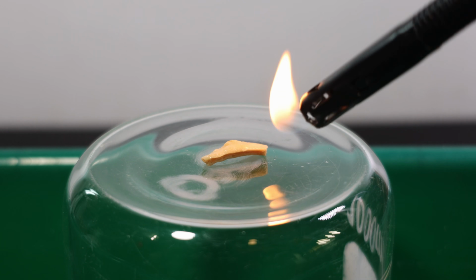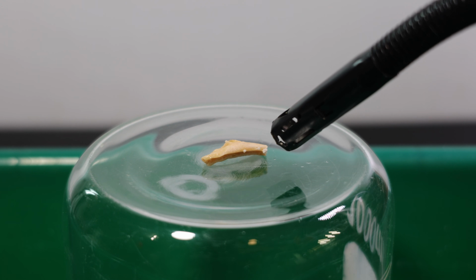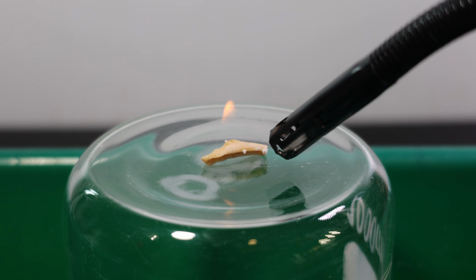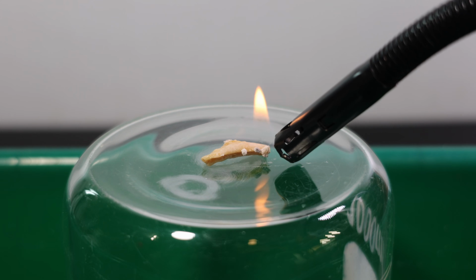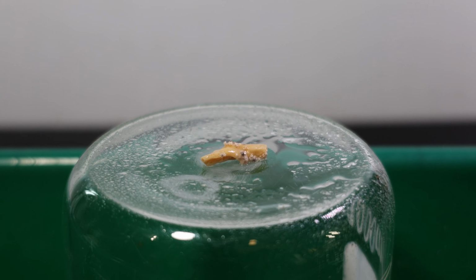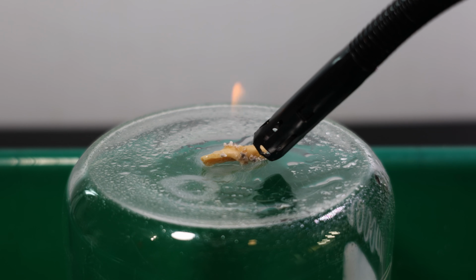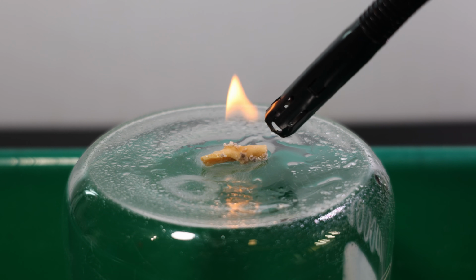Like the methoxide, the first test is to burn it. It actually seems pretty resistant to fire. Little, I'm guessing carbonate bubbles are being exuded instead. I spray it with some water, but I still get nothing. Even with more water, it doesn't burn. This isn't looking good, guys, but maybe it's coated with like a toasted potassium carbonate shell.